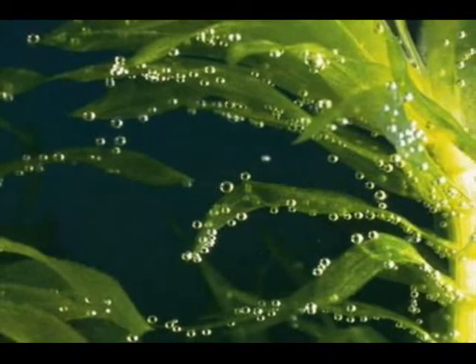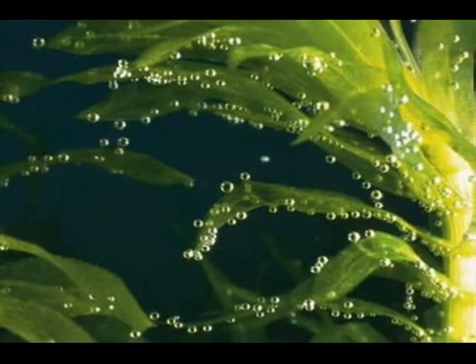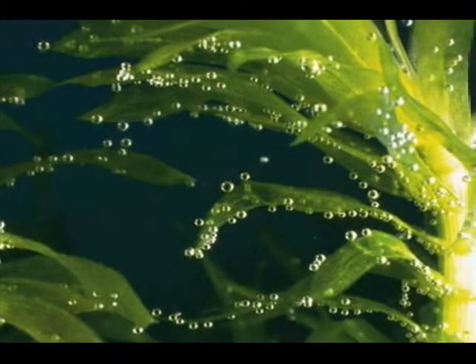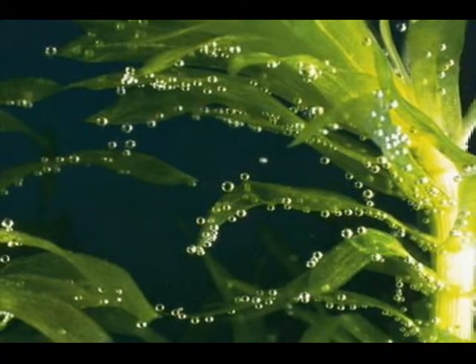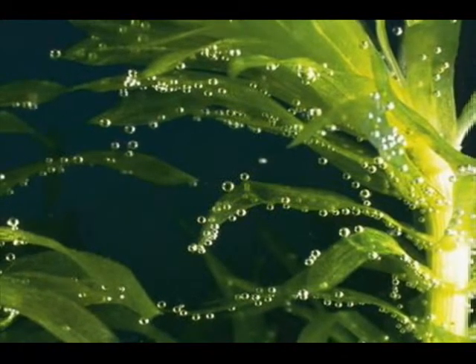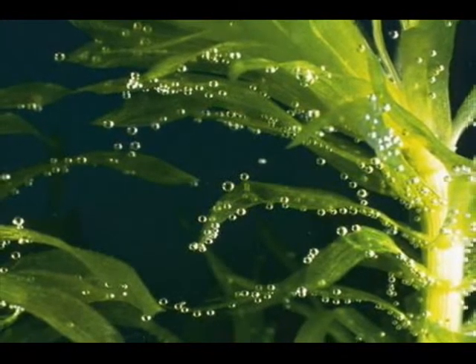This is Elodea canadensis, also known as American Water Weed. It is a native aquatic plant of North America, commonly found in lakes.